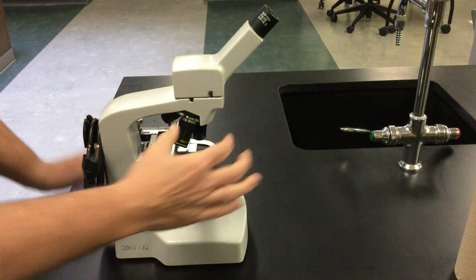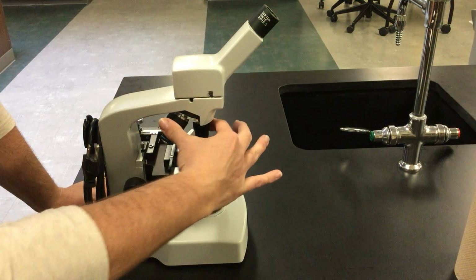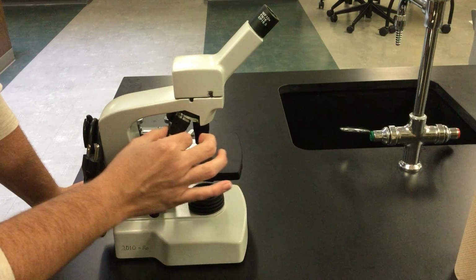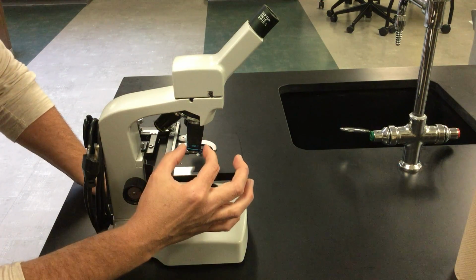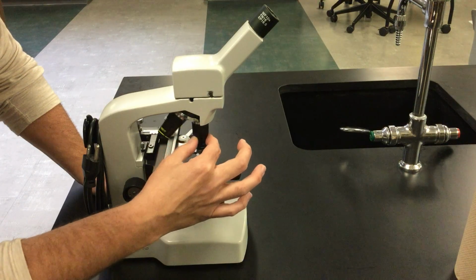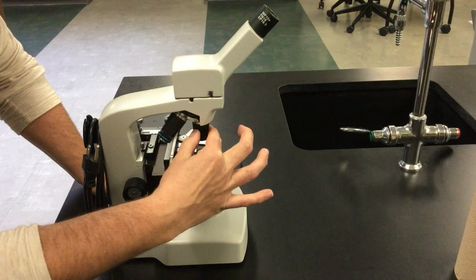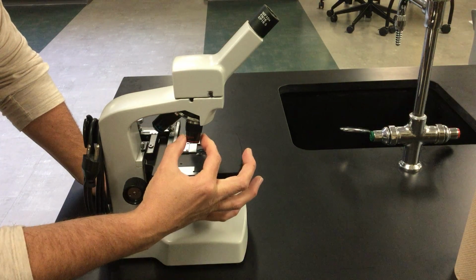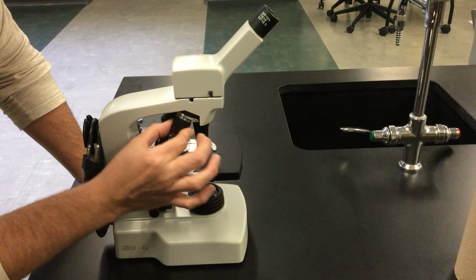Looking more closely at the microscope in this area, this rotating part is what we call the revolving nose piece. You can see that it rotates around so that we can use various lenses. Looking at our revolving nose piece, there are 3 different lenses encased in what we call objectives. This first one, the red one, is a 4-power objective. It magnifies by the power of 4.